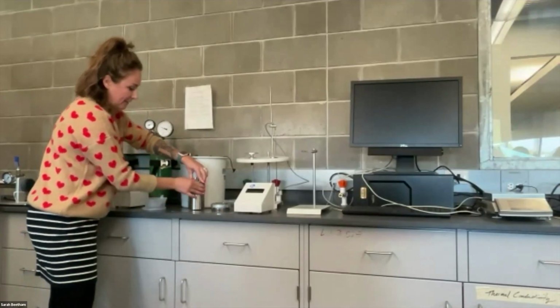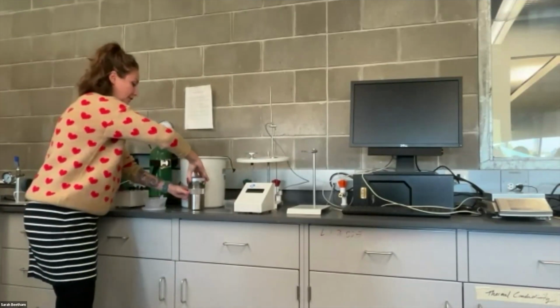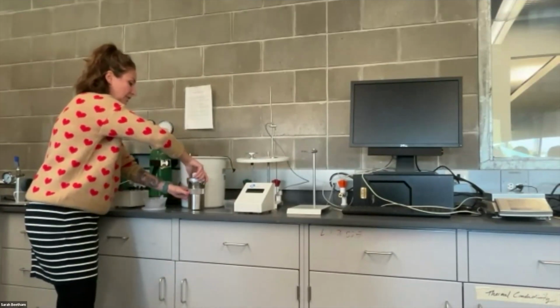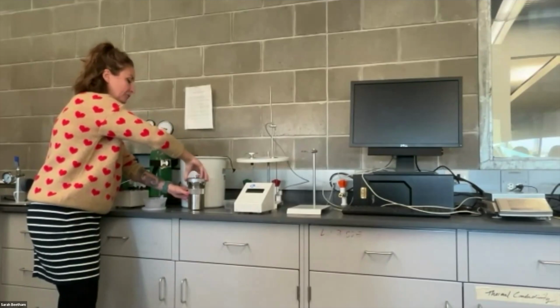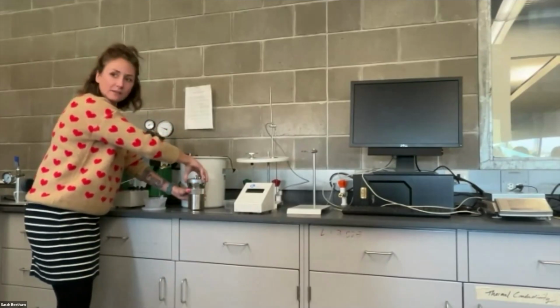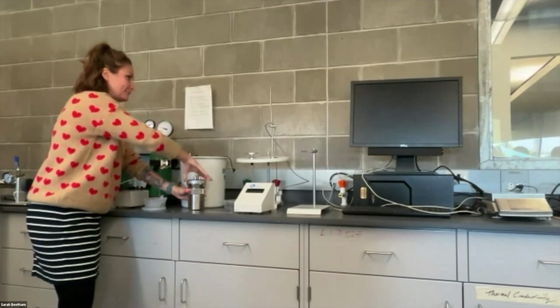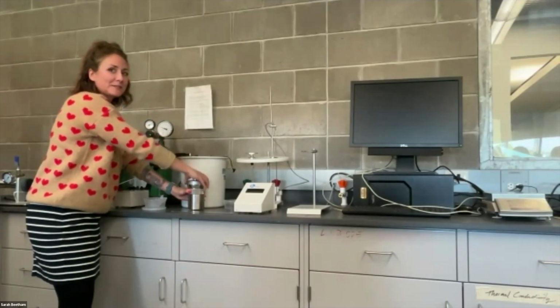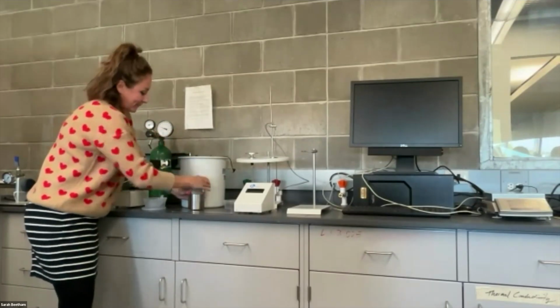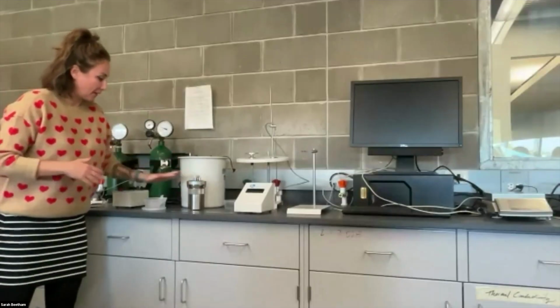And then you're just gonna set this in here. You take the lid and this just screws on. All right, so you want to screw this on, careful to not jostle it. And then this should be kind of hand tight. There's quite a bit of thread, so it takes a minute. Okay, there we go. Okay, so here's our bomb setup.